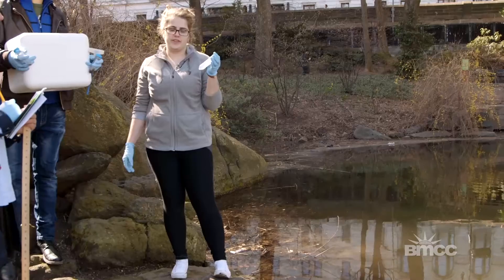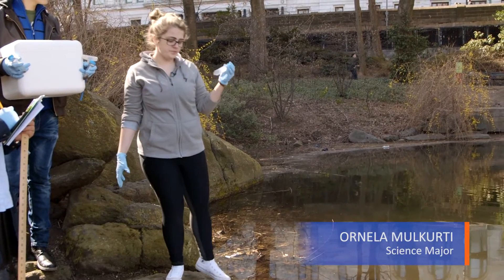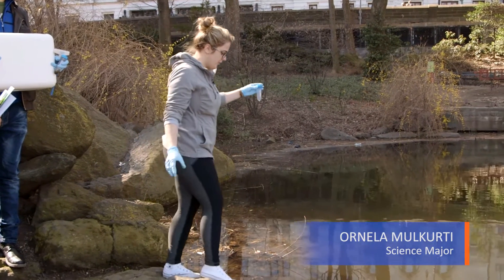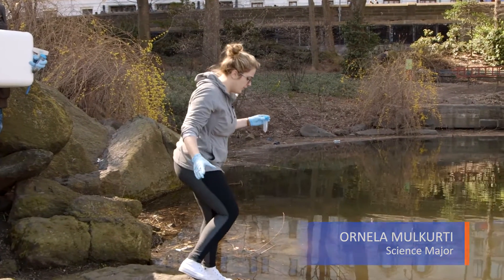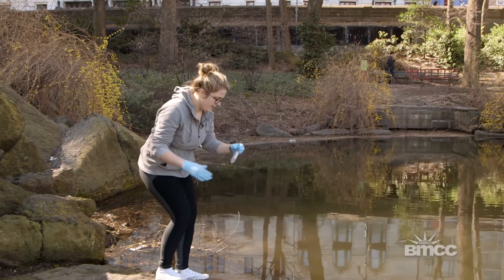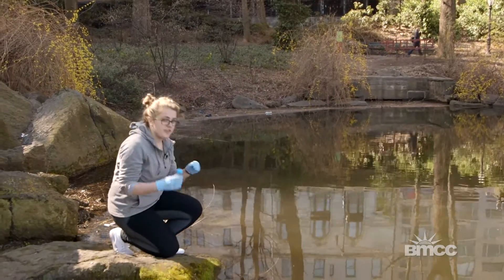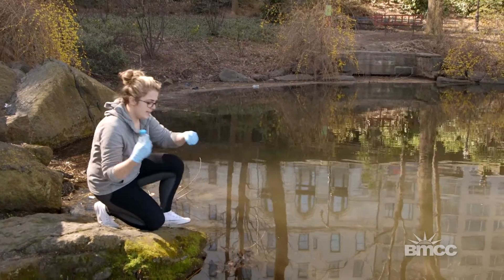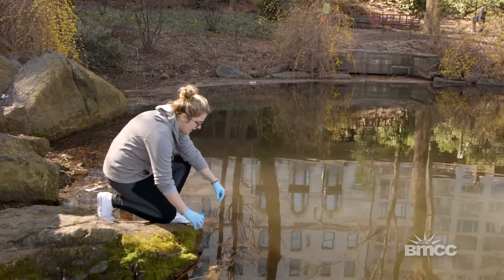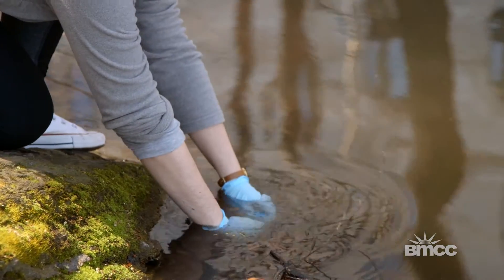First we start with a sterile cap tube, and we're going to go close to the water and make sure that we open that cap tube after we have dipped it under water.